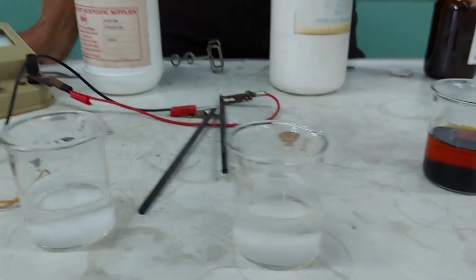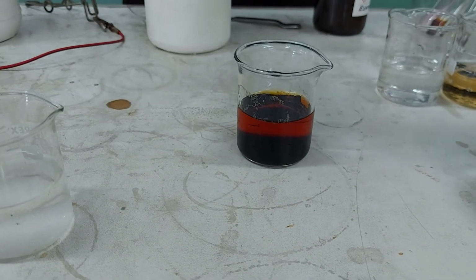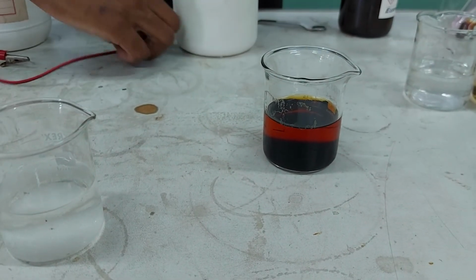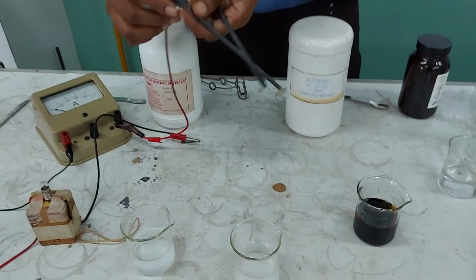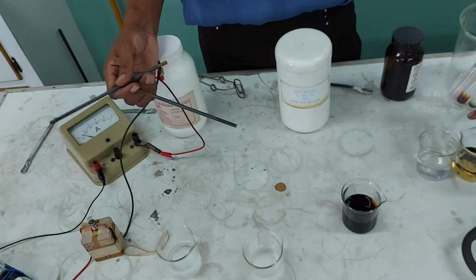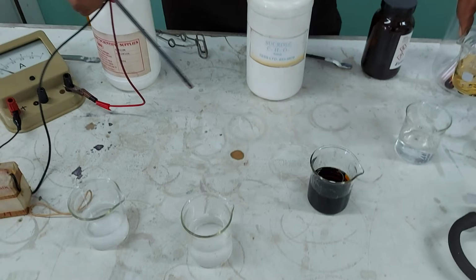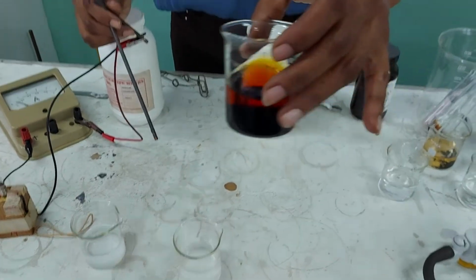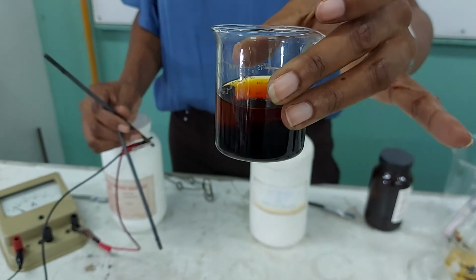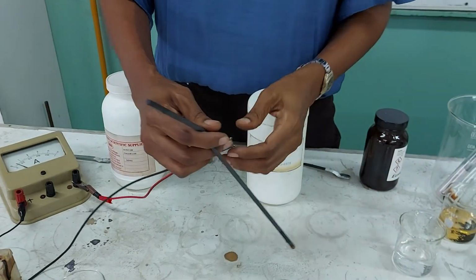Okay, the last one, as we round up this, is going to be looking at the conduction of iodine. Iodine in alcohol. Now, you remember what iodine looked like when we tried to dissolve it in water, didn't you? If you don't remember, this was the attempt to dissolve iodine in water. This is what happens when we dissolve iodine in ethanol. Wow, great difference. I want an explanation for that. What do you think is going on there?